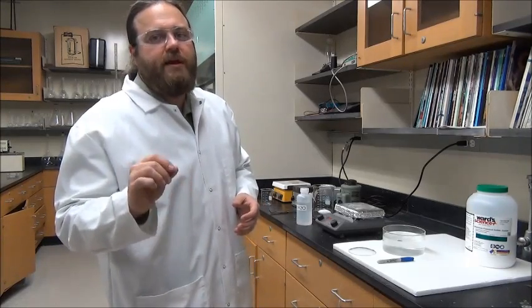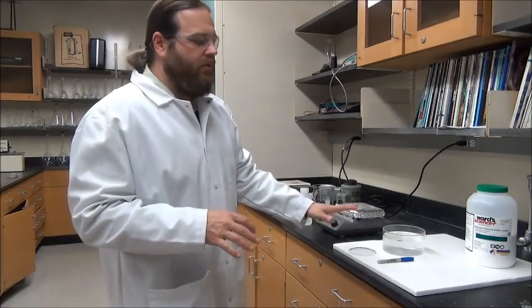We'll go ahead and let this sit. You'll notice it's sitting on a styrofoam pad to sort of thermally insulate our container from the countertop. One tip at home is that crystals generally really like to grow in dark, noise-free environments, so under cabinets and things like that are ideal places to grow crystals. For the purpose of this video, I'm going to grow on this countertop, but I am using this styrofoam to help insulate it from the temperature of the counter and give it a little bit of a cushion to sit on so that there aren't too many vibrations. Next up, we'll see how and when these crystals start growing.